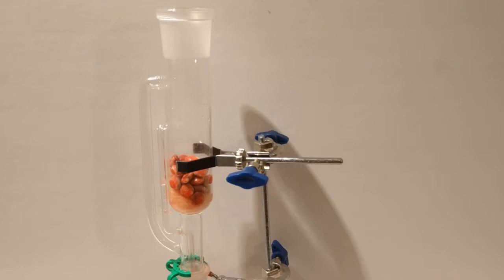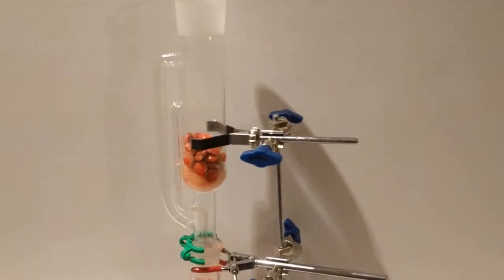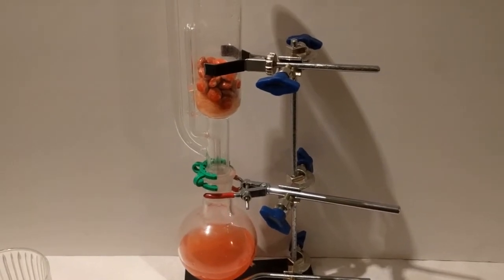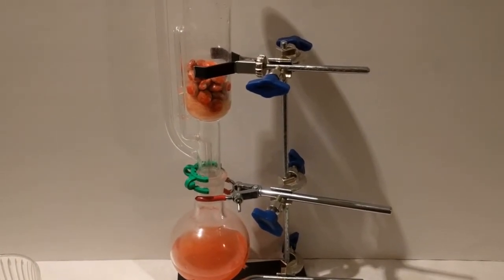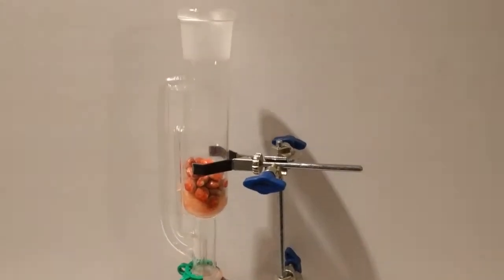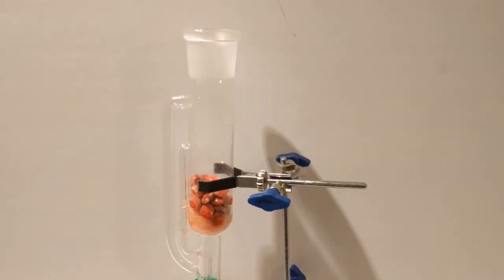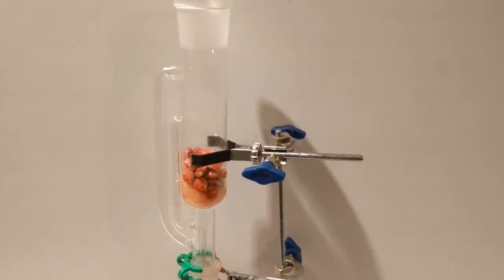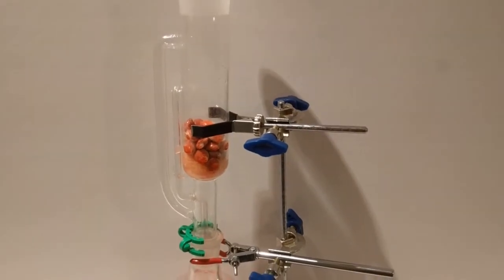There, another successful siphoning. So our collected stuff goes into this flask on the bottom, which would be heated with vaporizing all the way up to the top. And usually we would have a condenser on the top. So this pure distilled vapor would be dripping onto our target stuff and then siphoning off, taking things with it. That way we'd have a continuous collection through a pure solvent, without adding more and more solvent to the system.